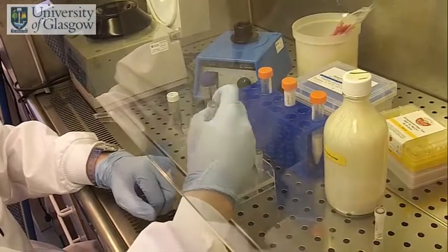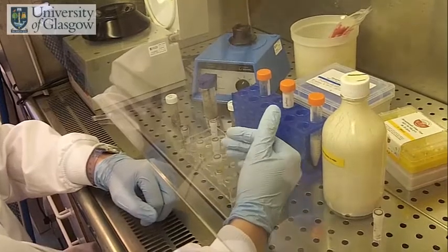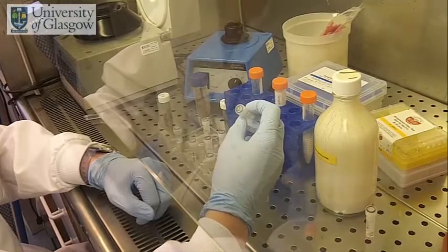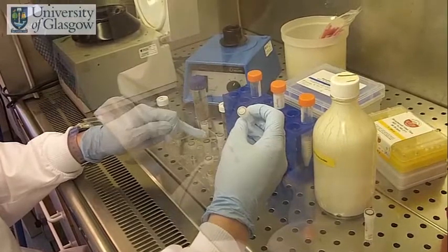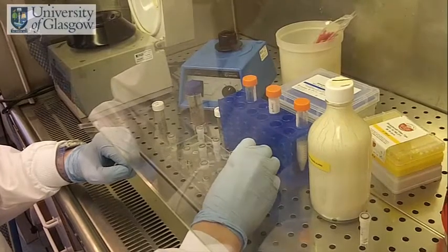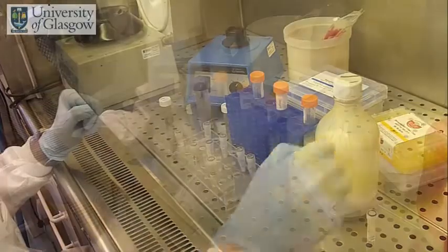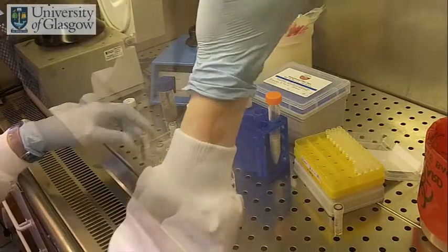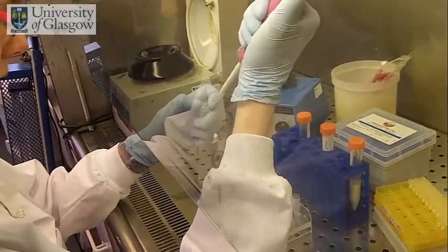So for the sample proper, we've got a dilution in water. For this one, it's a dilution in positive control. The reason we're doing that is to try and show that there is no inhibition being caused by the fecal sample. The positive control should give a band exactly equal to our spike for our sample. The reason for this is there is no difference other than the fecal sample being added to the spike, therefore you should get a band of equal intensity for both the positive and for the spike.